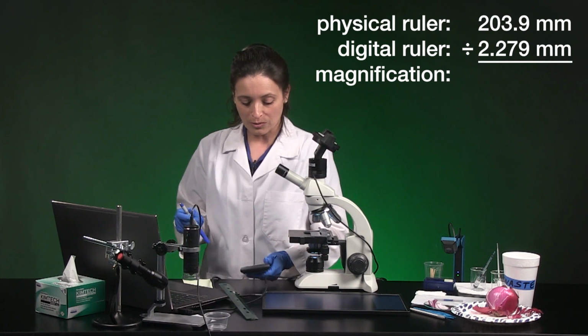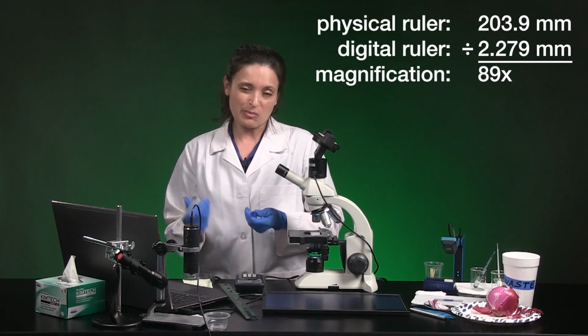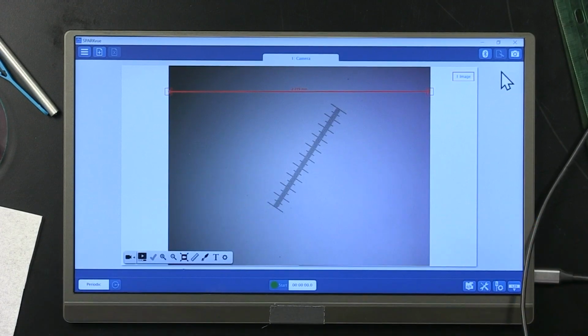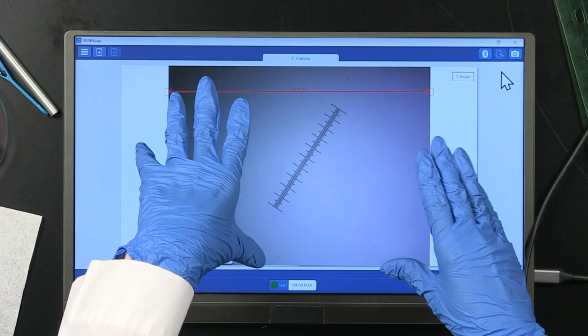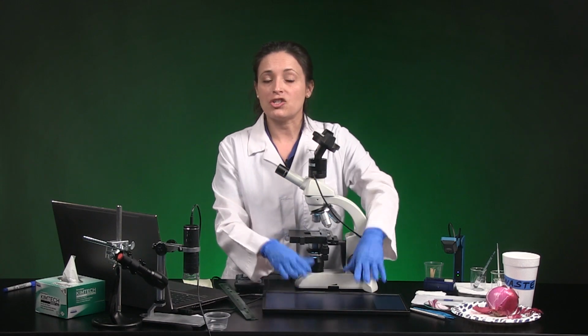And I'm going to round that to a whole number. And I get 89 times, about 90. So 89 times every time. I'm looking at 89 times magnification on this screen. If we think about the optics, it's 40 times magnification through the scope, 89 times on the screen. This is why we have to do magnification power for each thing we're looking through.